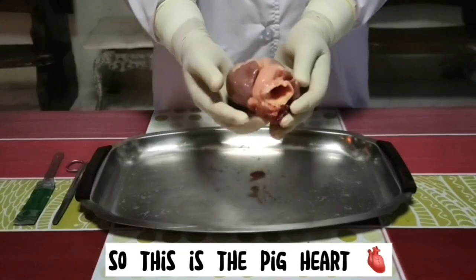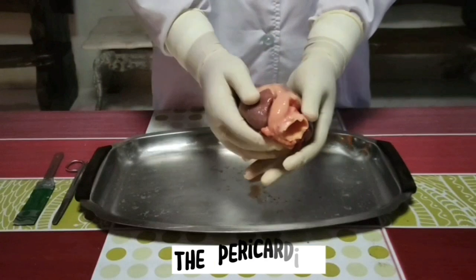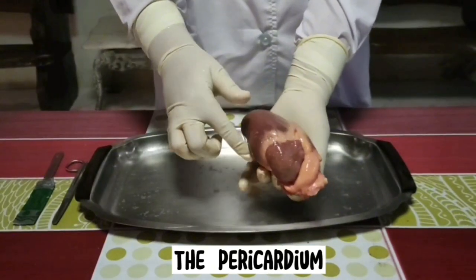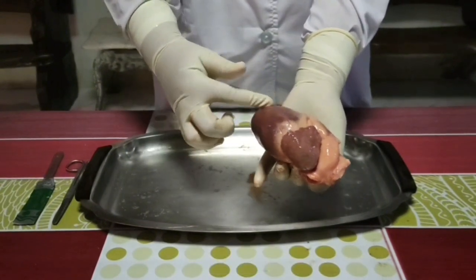Talimungan, BSN 110 Alicud. For this video, I'll be showing to you how to dissect a pig's heart and locate each part of it. So let's start! So this is the pig heart. This is the pericardium that still covers the heart. The pericardium or pericardial sac is a double-layered closed sac that surrounds the heart and anchors it.